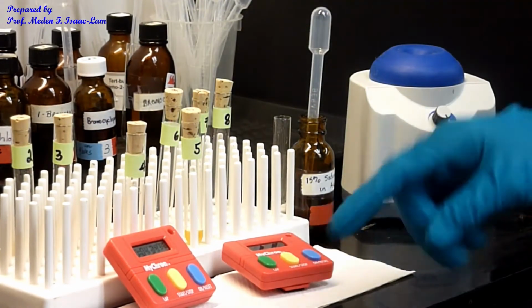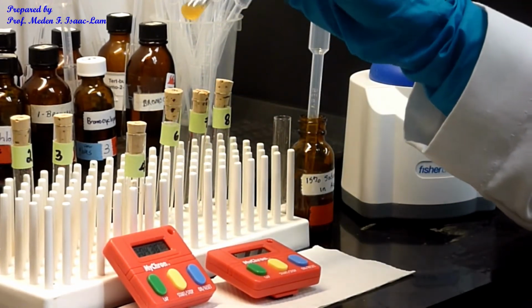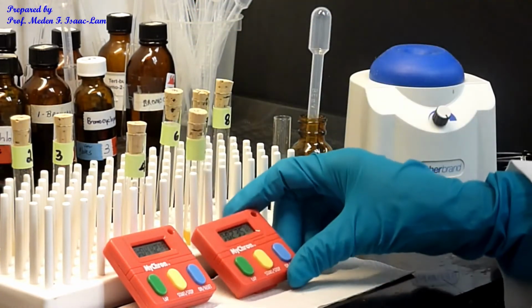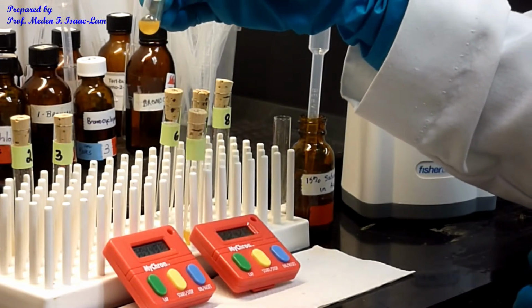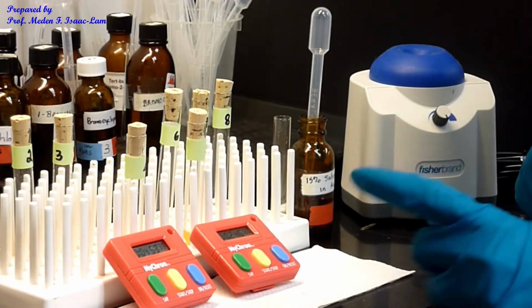Okay, so we'll wait for this one, almost done. And I actually see a little bit. And then I'll stop it at 5 minutes.